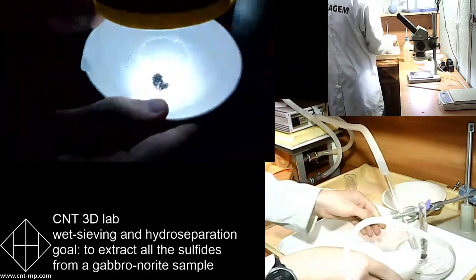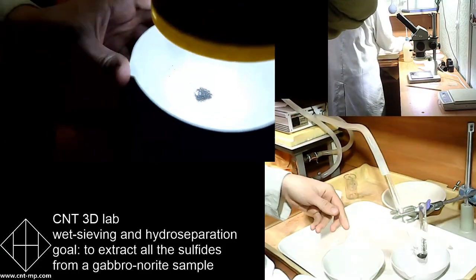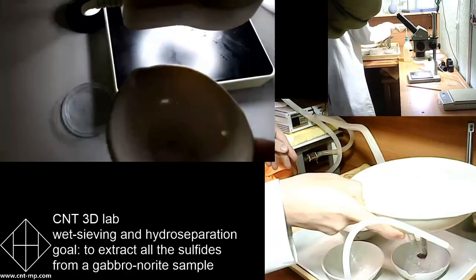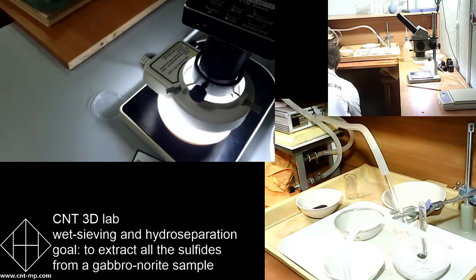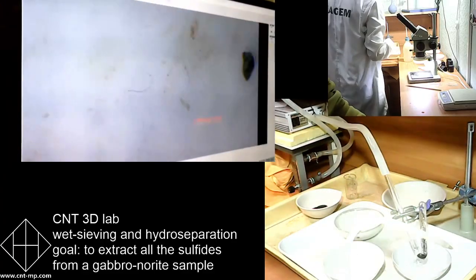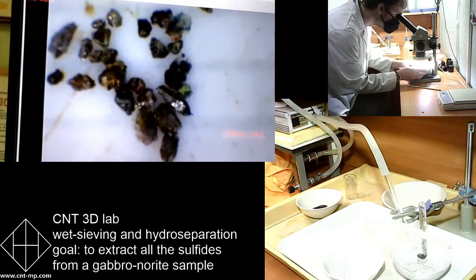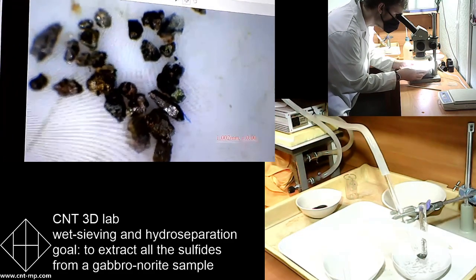So it's very easy looking, very easy, right? But in a way, it's high tech, because one had to use knowledge to make this technology work. There were many people designing this technology, different physicists, different technologists, different engineers. So now it is fully operational for concentrating particles of different density.